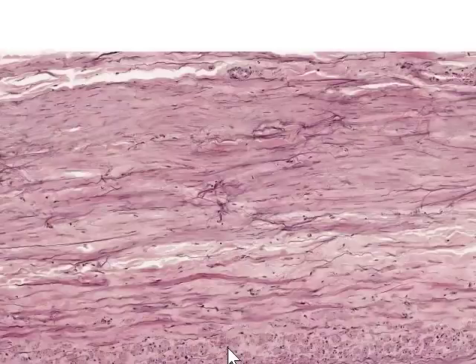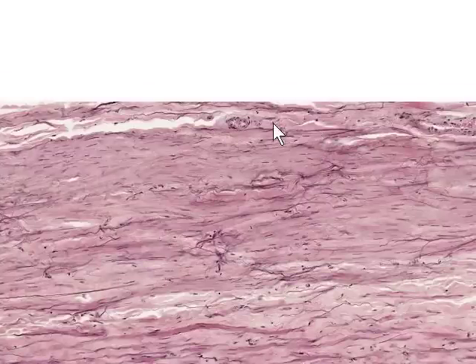I've reduced the magnification here again. When this specimen was prepared, the tunica adventitia was largely separated off from the tunica media and the tunica intima, so there's not much adventitia present. The boundary between the tunica media and the tunica adventitia occurs along this line just about here, and once we enter into the tunica adventitia we can see vasa vasorum.